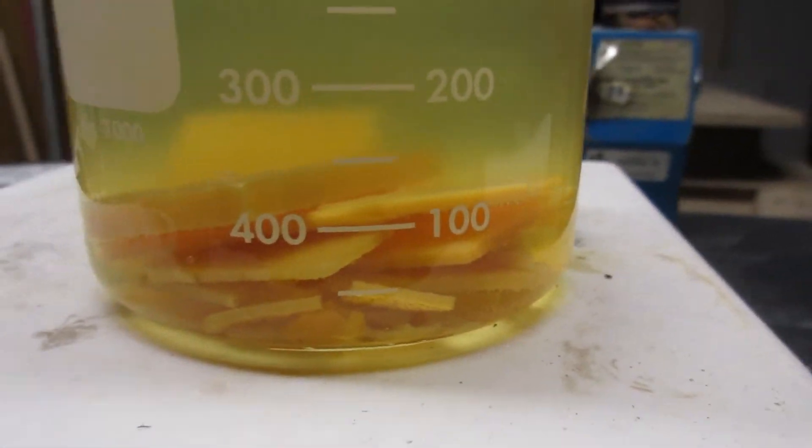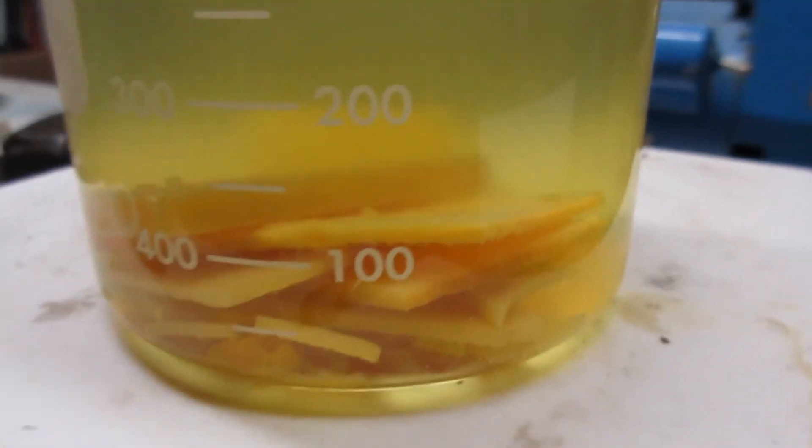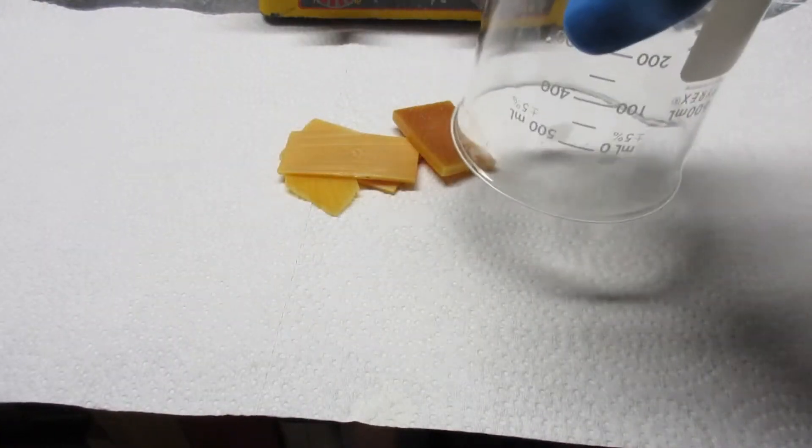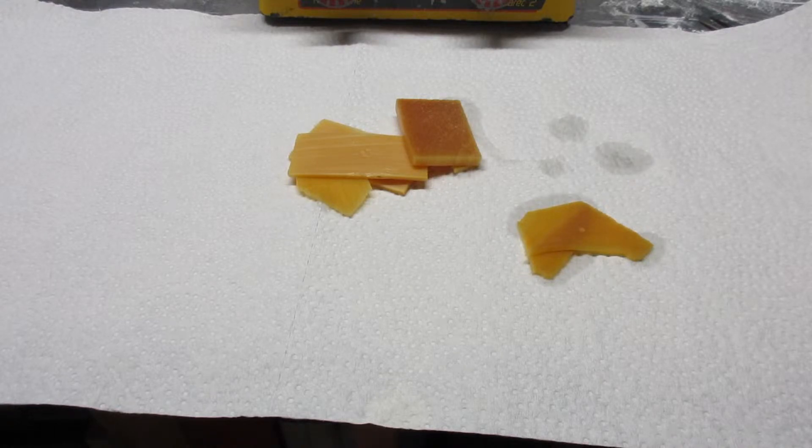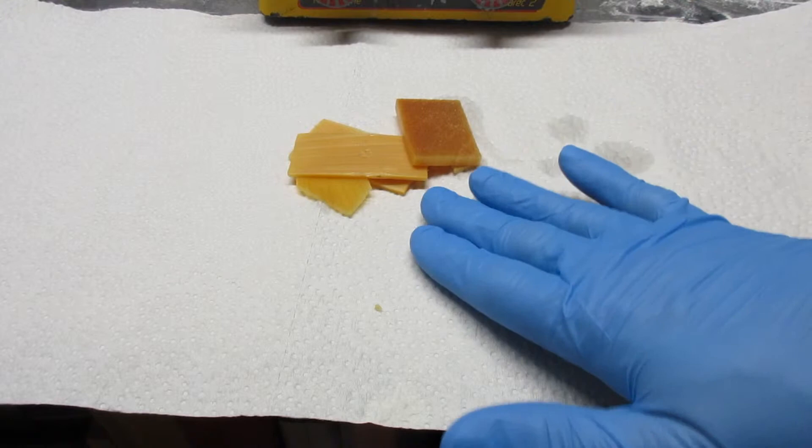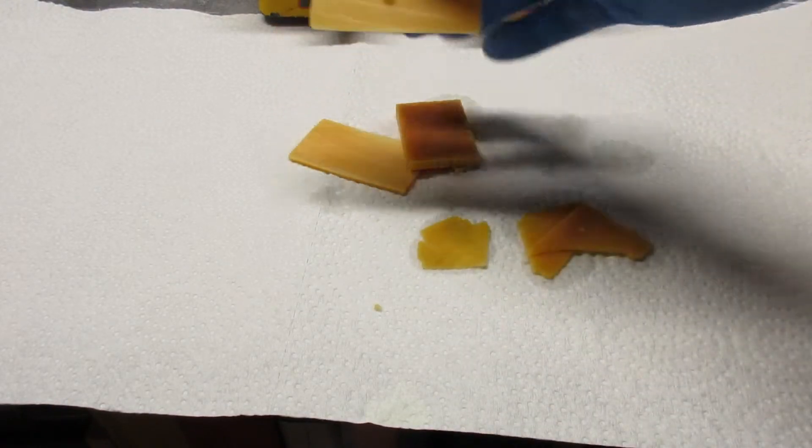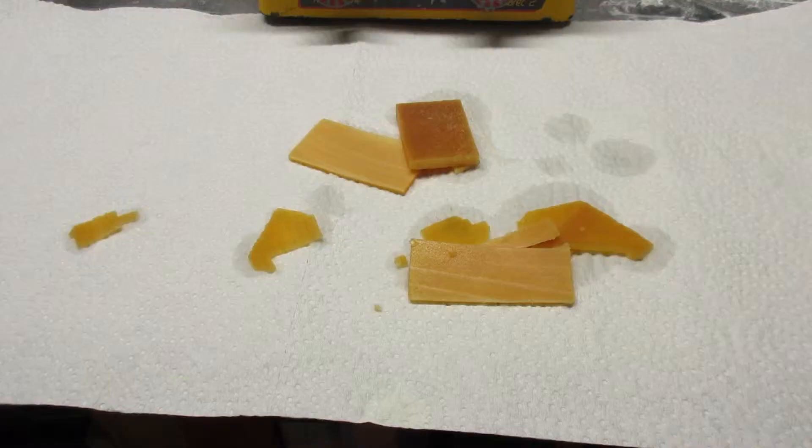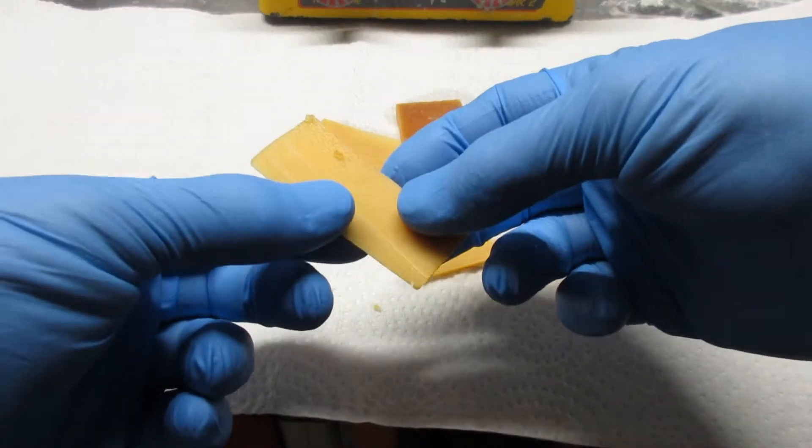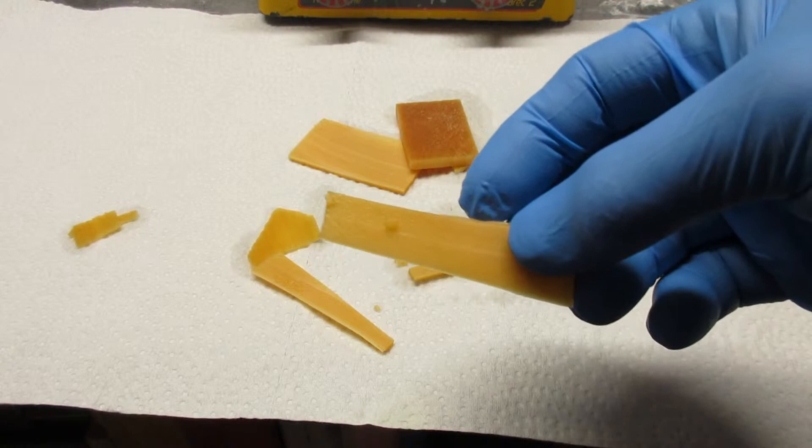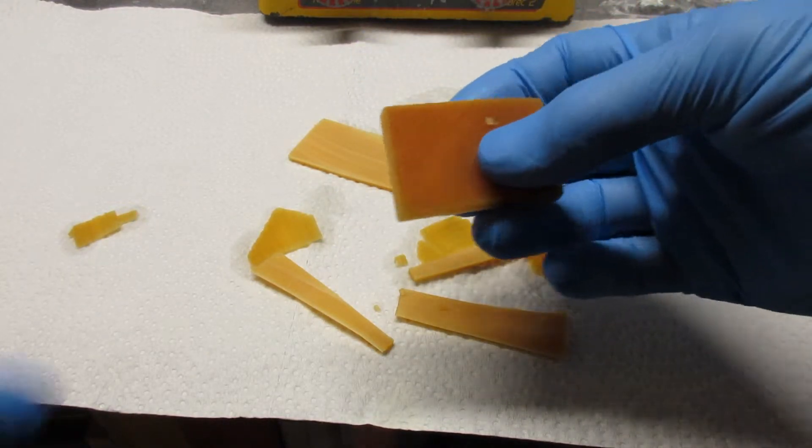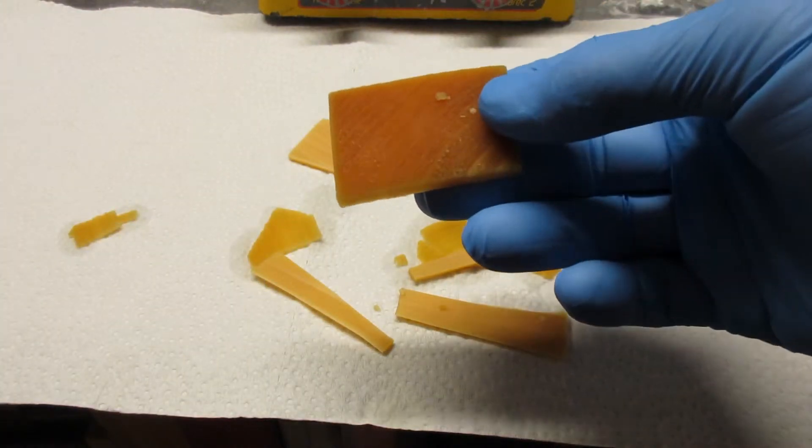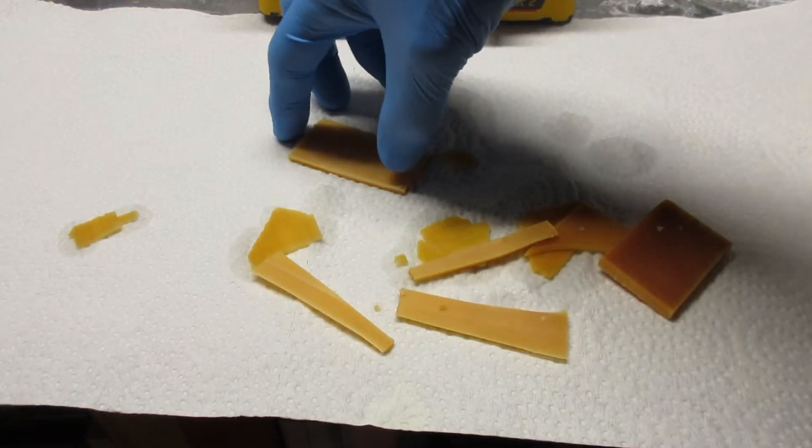Well I kind of fucked up here. It's been maybe 18 hours in this stuff—I left it overnight—and that was a bad idea I guess because some of my samples are disintegrating. Oh no. So I'll try and salvage what we can here. So some of the thinner pieces really did break apart and the longitudinal sections aren't—oh damn—so terrible. Even the longitudinal sections are very brittle. Damn it.